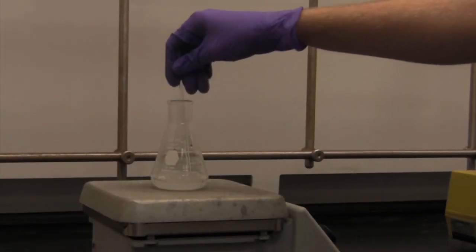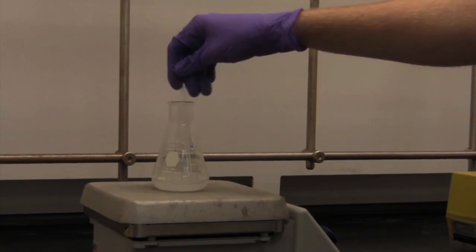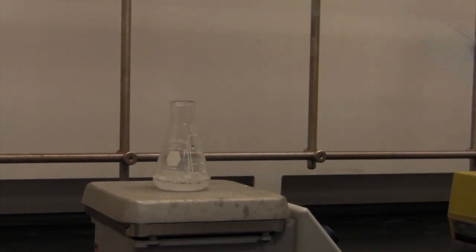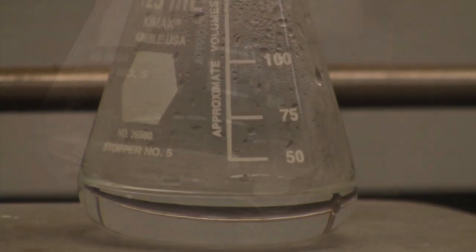The impure solid is added to the solvent, then the solvent is heated and stirred until the solid is completely dissolved.